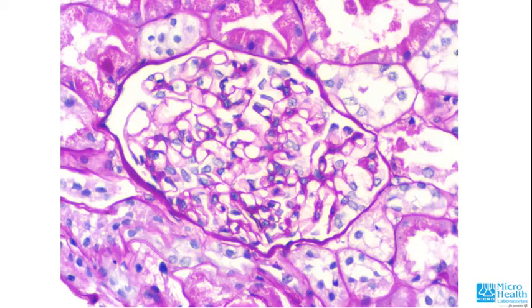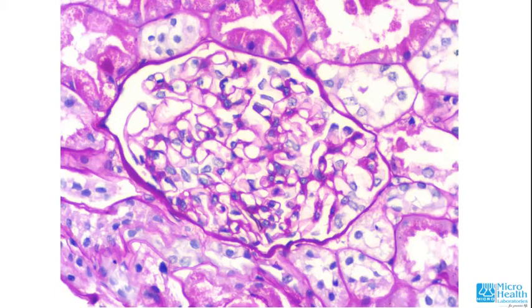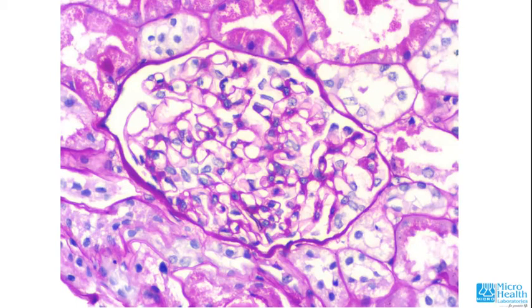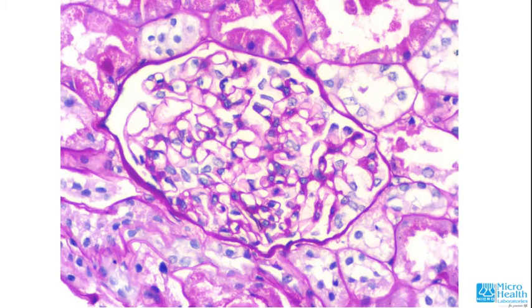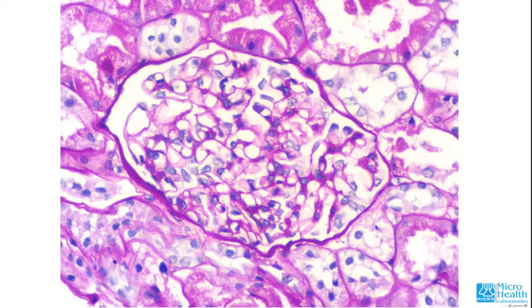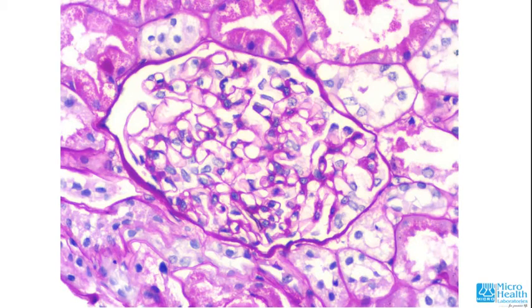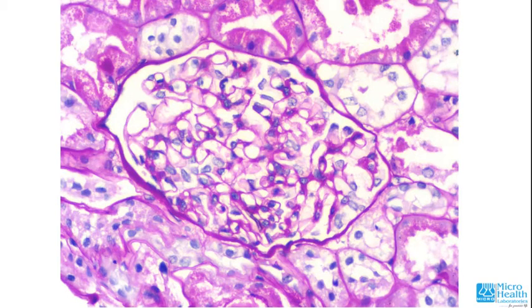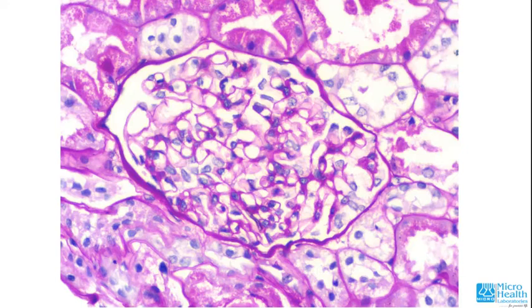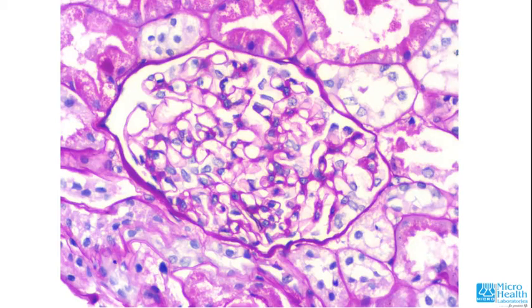Diseases that can mimic a normal glomerulus on light microscopy include minimal change disease, which presents with nephrotic syndrome and looks exactly like this. We require electron microscopy to look for effacement of the foot processes of the podocytes. Another condition presenting with hematuria that looks normal on light microscopy is thin basement membrane disease, where electron microscopy shows the basement membranes are thinner than normal.